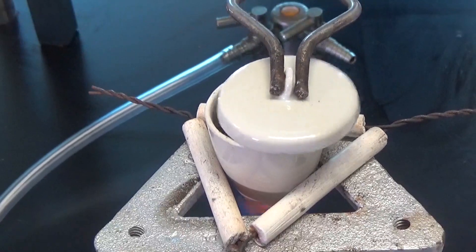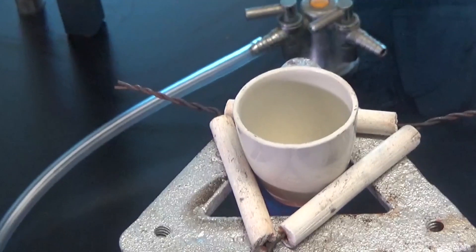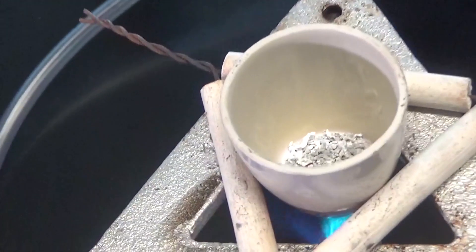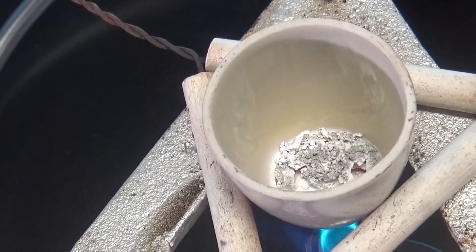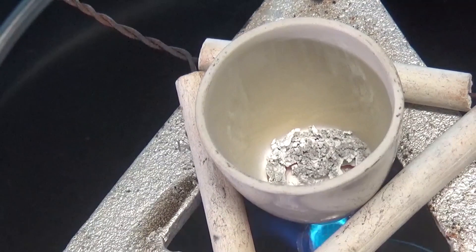So just so that you can see what's happened here, we'll take the lid off. You can see that the magnesium has all reacted with the oxygen. It's no longer shiny magnesium, it's a white powdery substance.